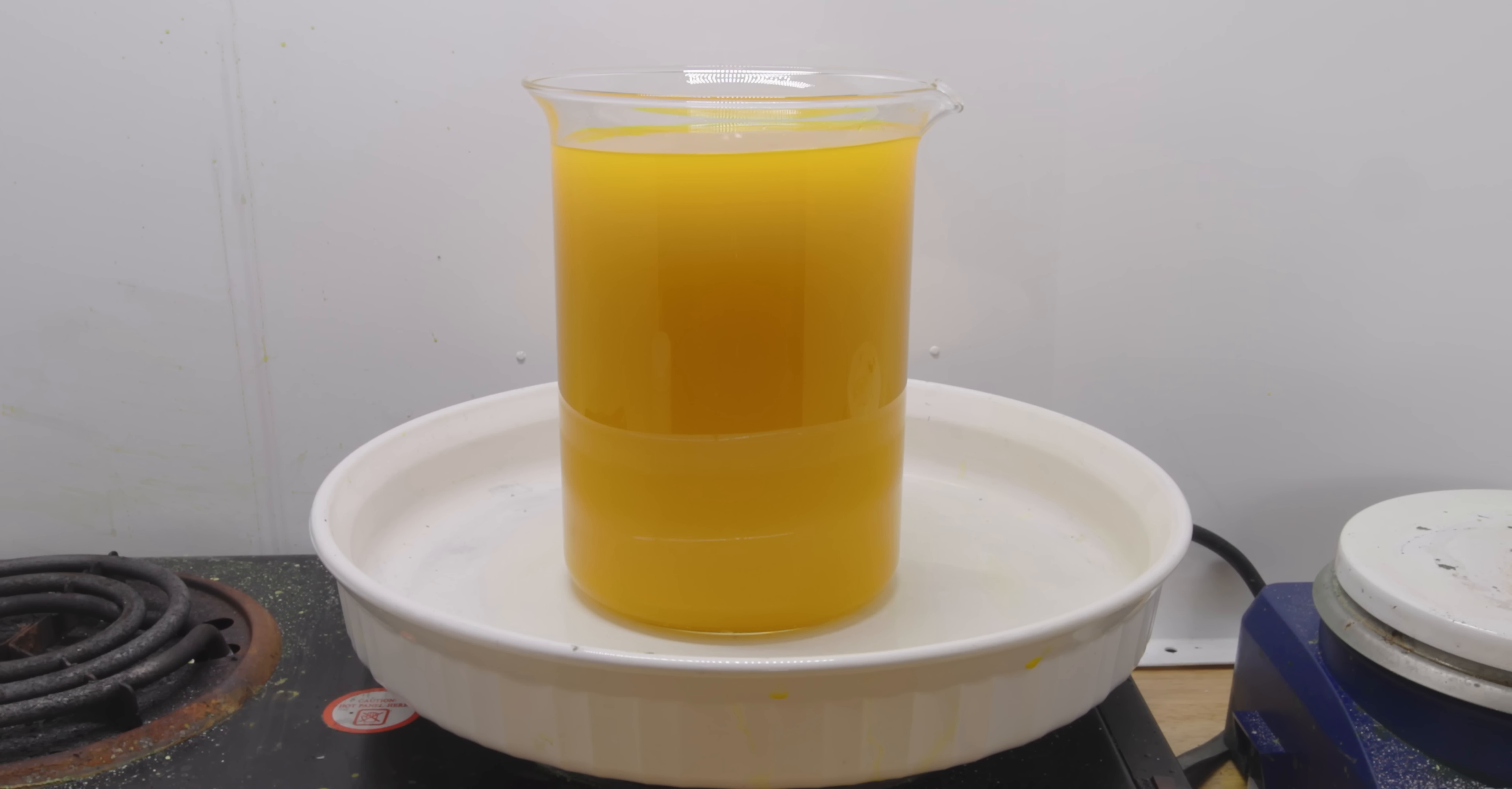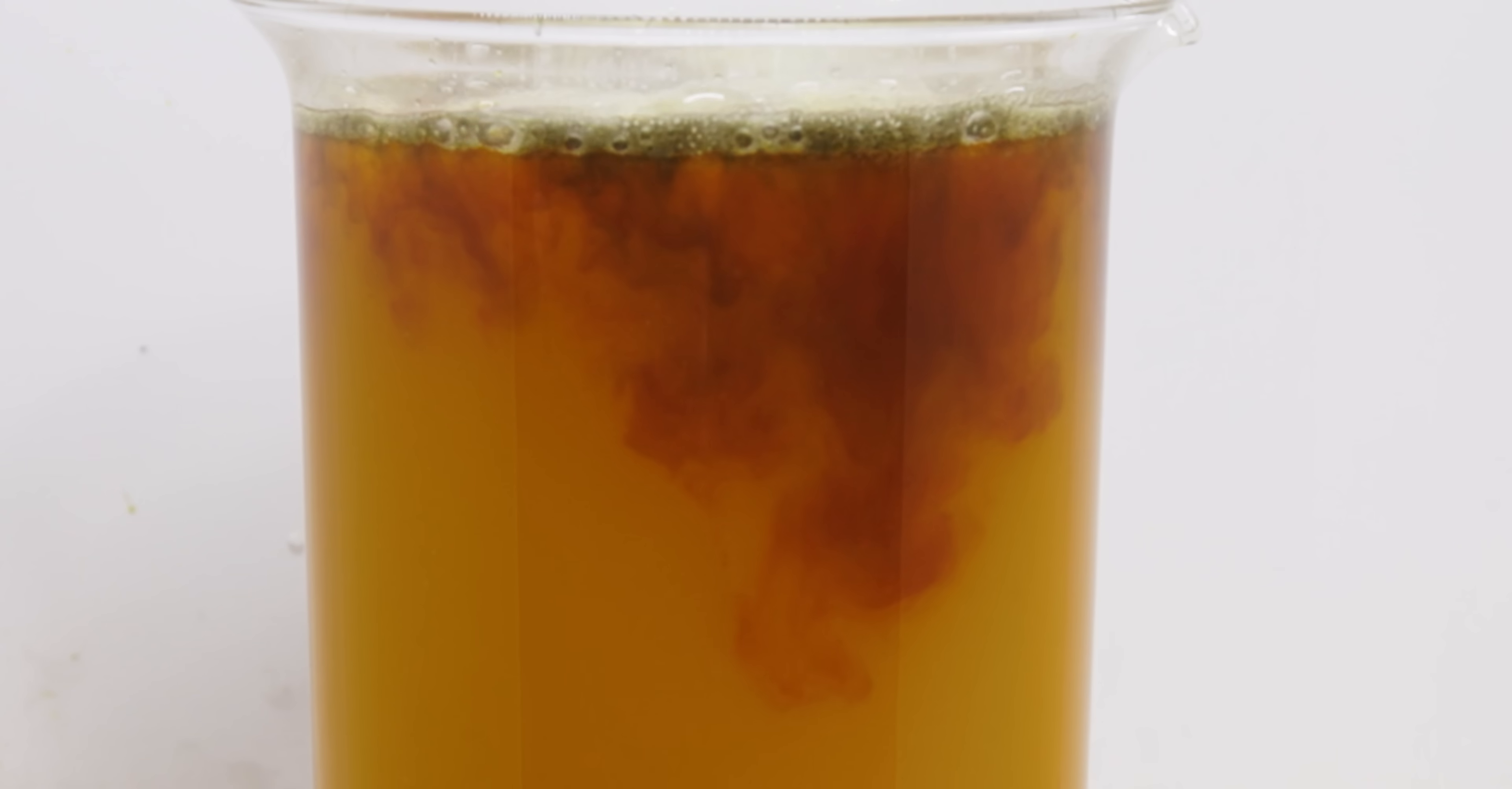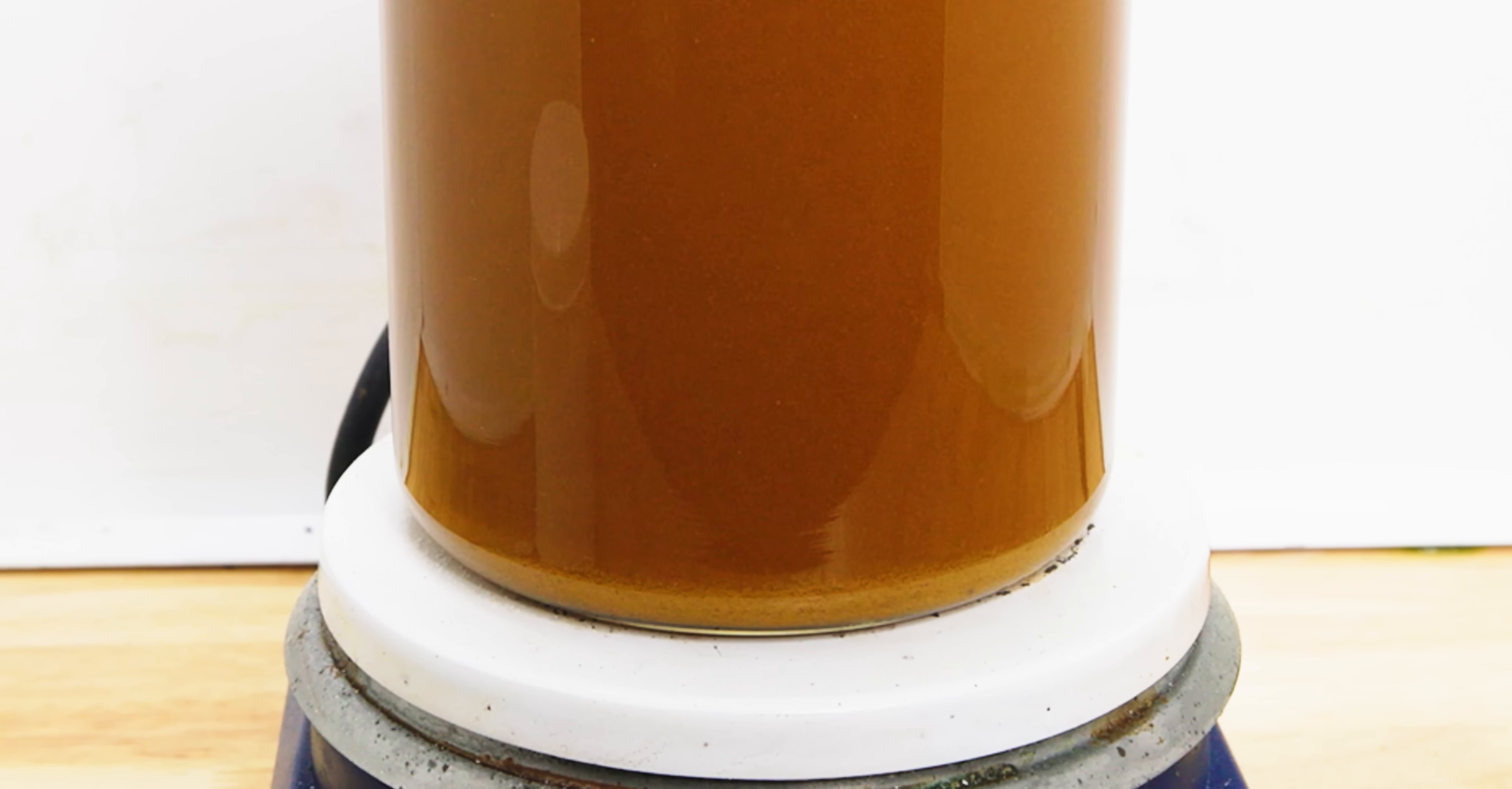Remember the last time we added sodium metabisulfite and couldn't see our gold precipitating very well? Check this out. I keep adding scoops while the gold collects at the bottom.